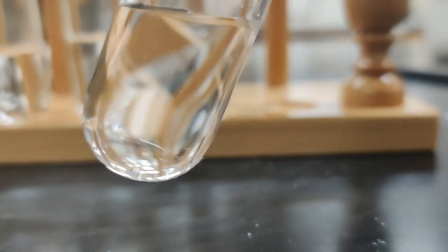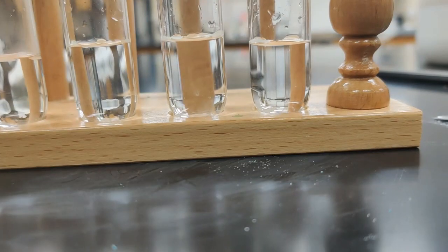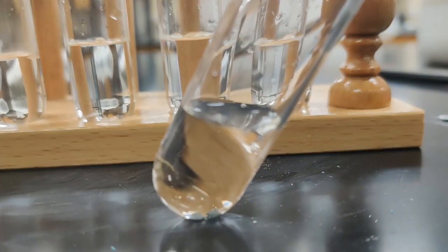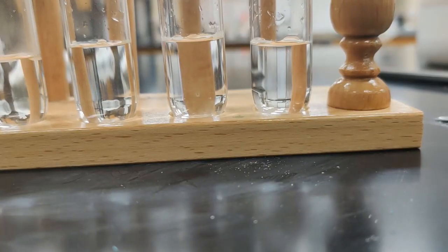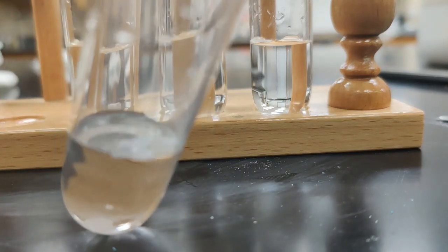So in water, what we've been testing here, solubility in water, we can see that our iodine, let's see if we can kind of see those down there at the bottom. The iodine is just hanging out at the bottom, not really doing anything very interesting at all. Ammonium chloride was very soluble. It completely disappeared. We can still see the naphthalene floating on the surface here of our water, so it's not soluble in water.